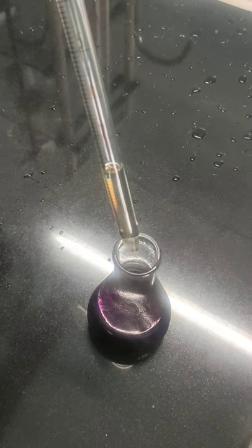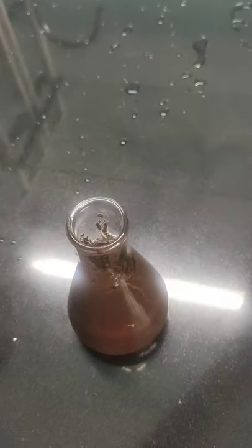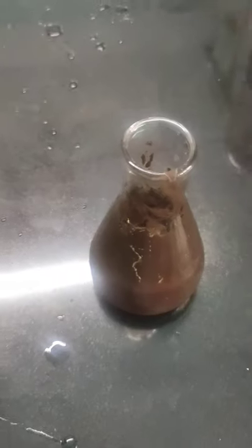Now I am going to add 2 ml of benzyl alcohol and stir the reaction mixture. You can look at the color of the mixture — it is almost brown. That indicates that the potassium permanganate has completely got reduced to manganese dioxide. This brown colored precipitate is your manganese dioxide, and this indicates that the oxidation reaction is complete.